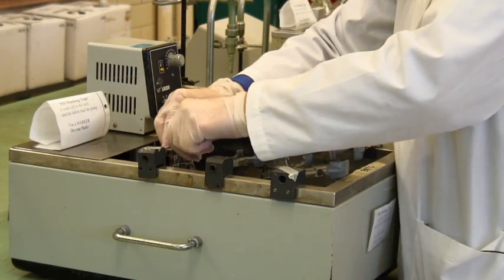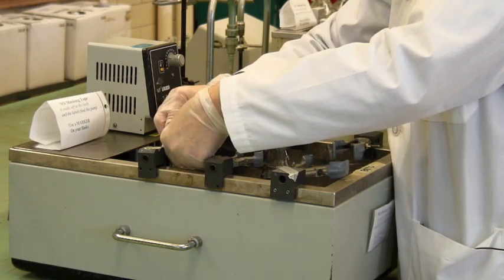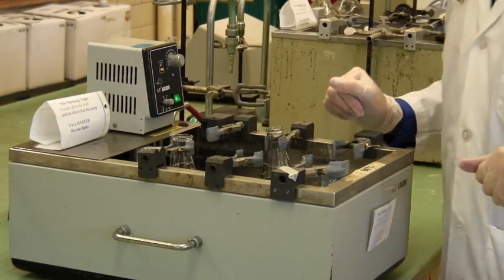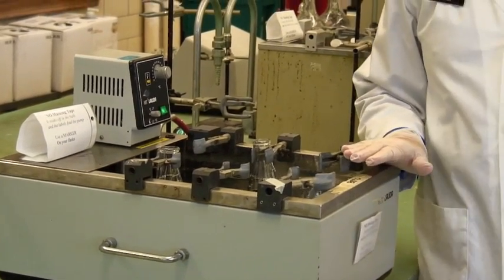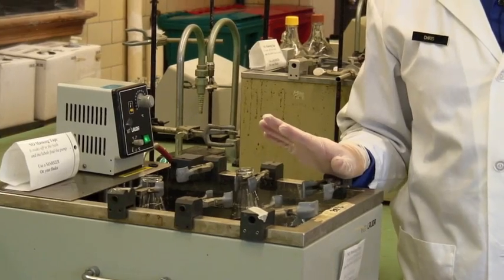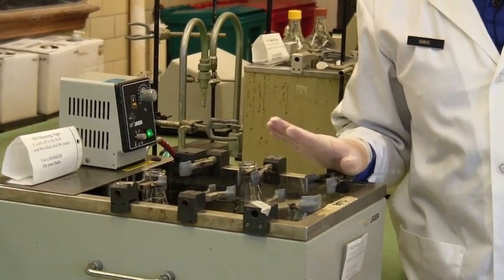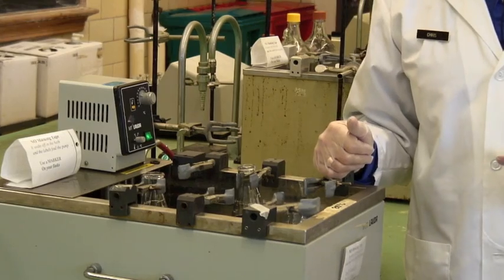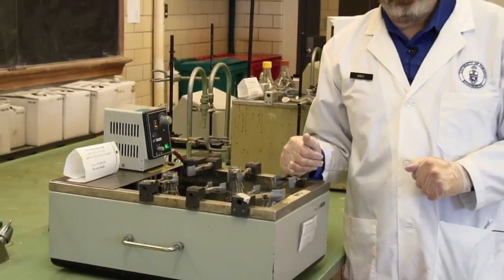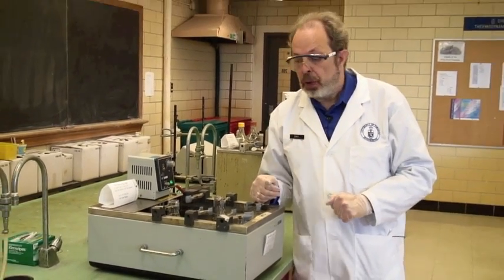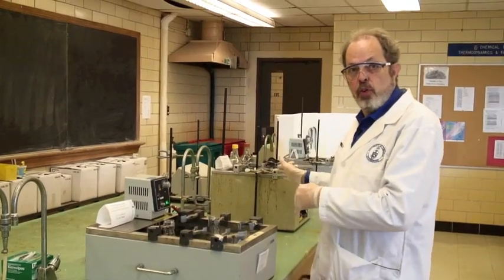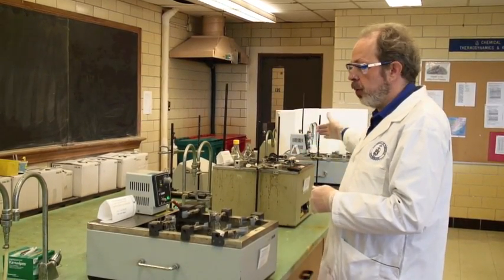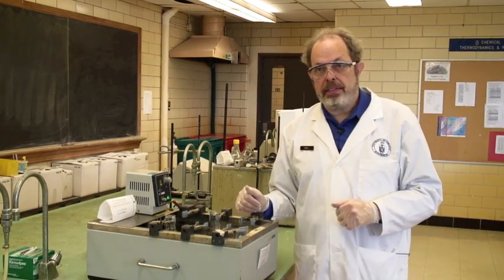You're going to be performing this experiment at three different temperatures, and this is the coldest one. Now, while these are sitting here equilibrating, let me talk a bit more about what you're going to be doing in general. You'll do the experiment three times over, once at 30, once at 40, and once at 50 degrees, and there we've got different temperature baths ready to go.